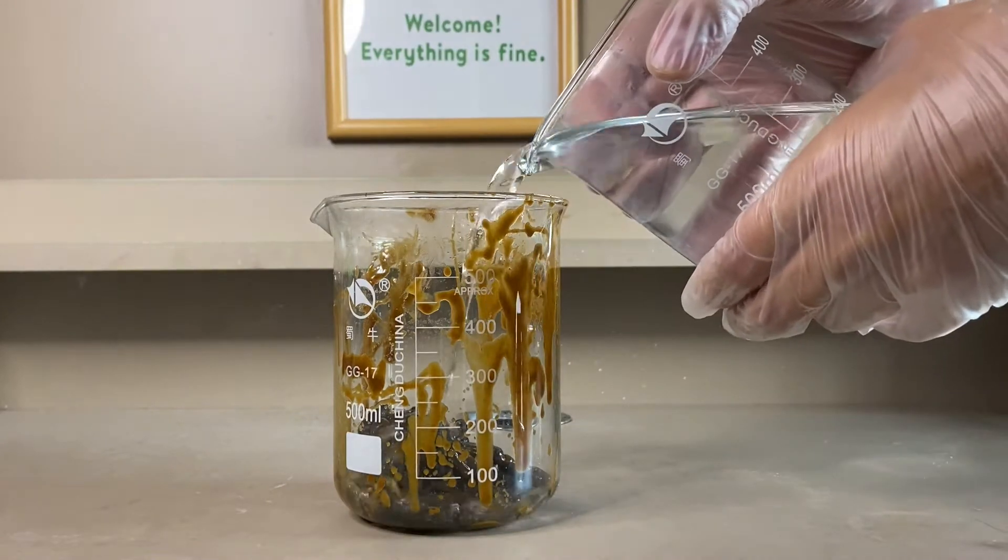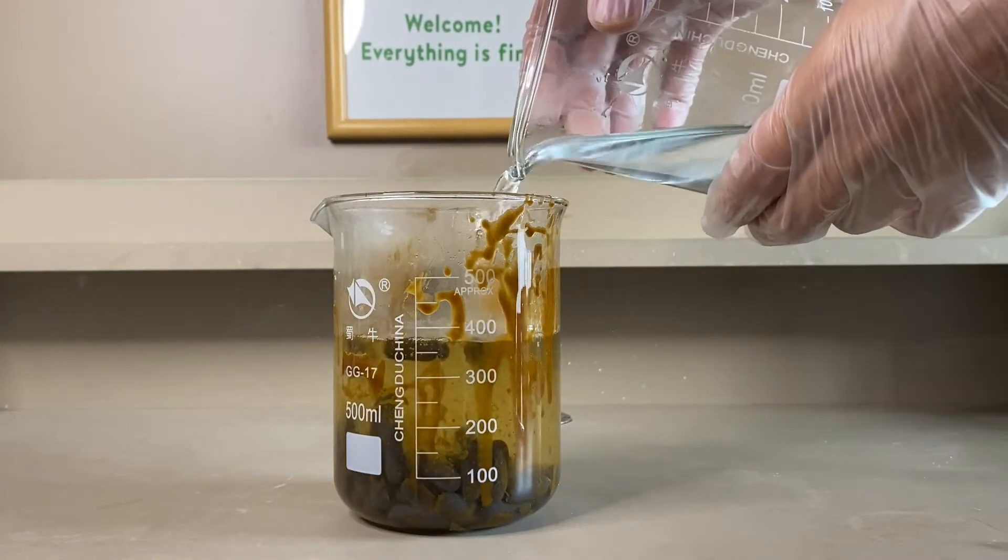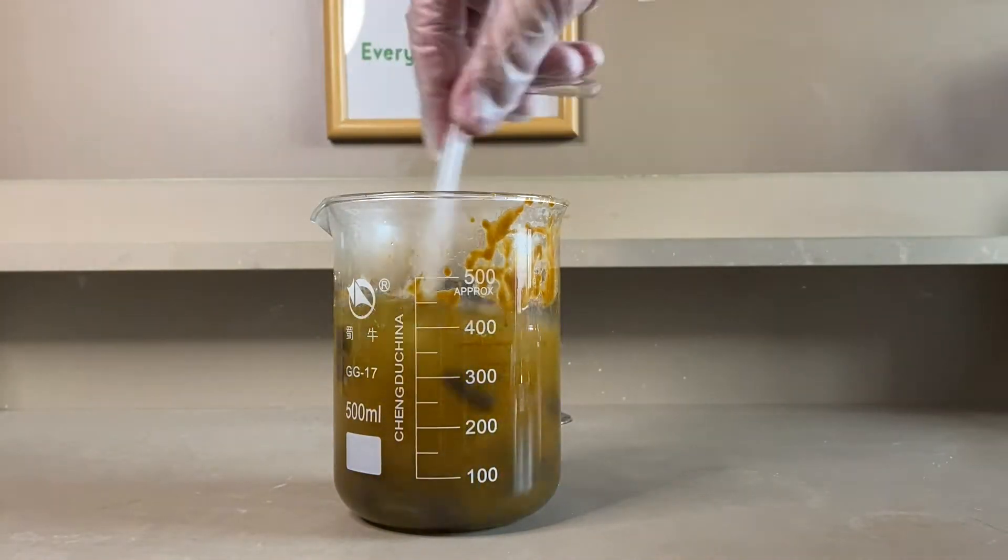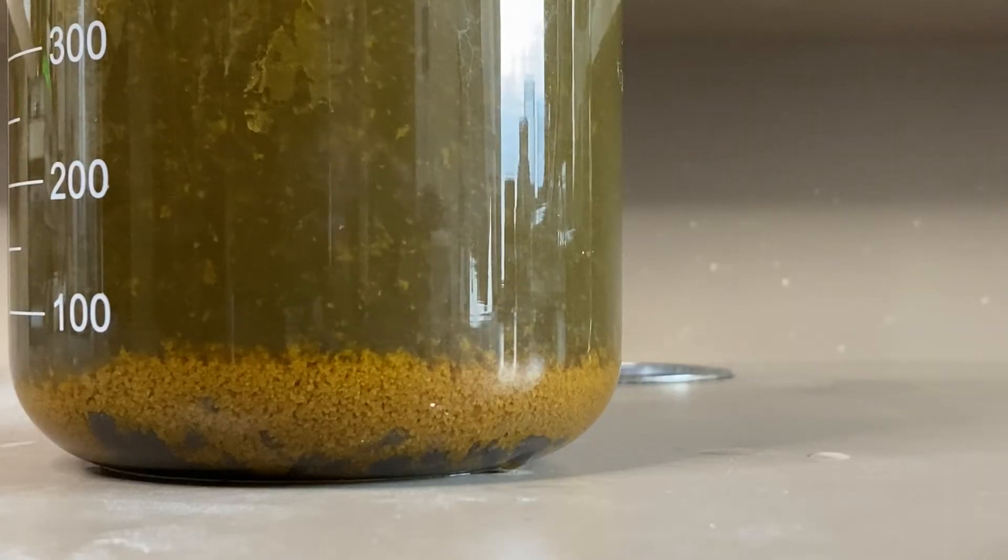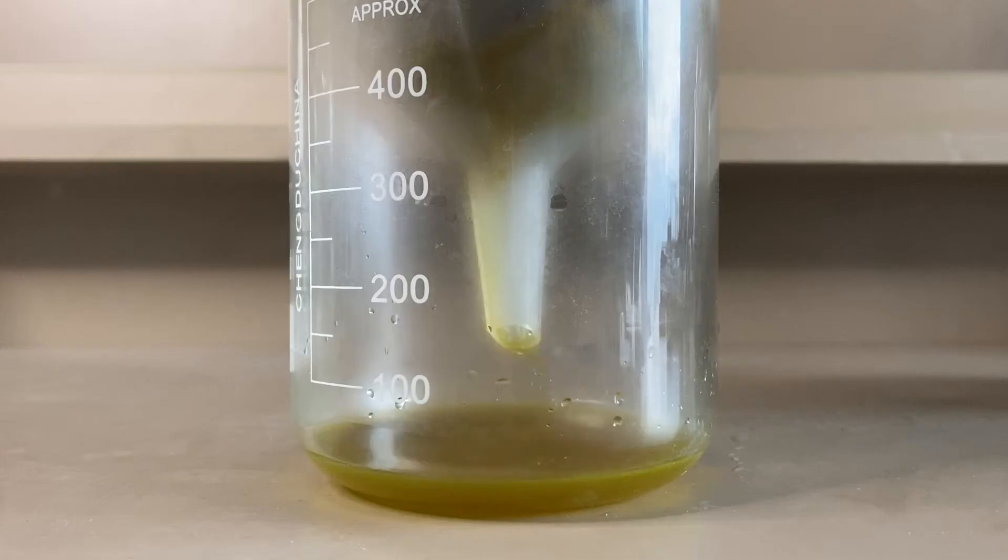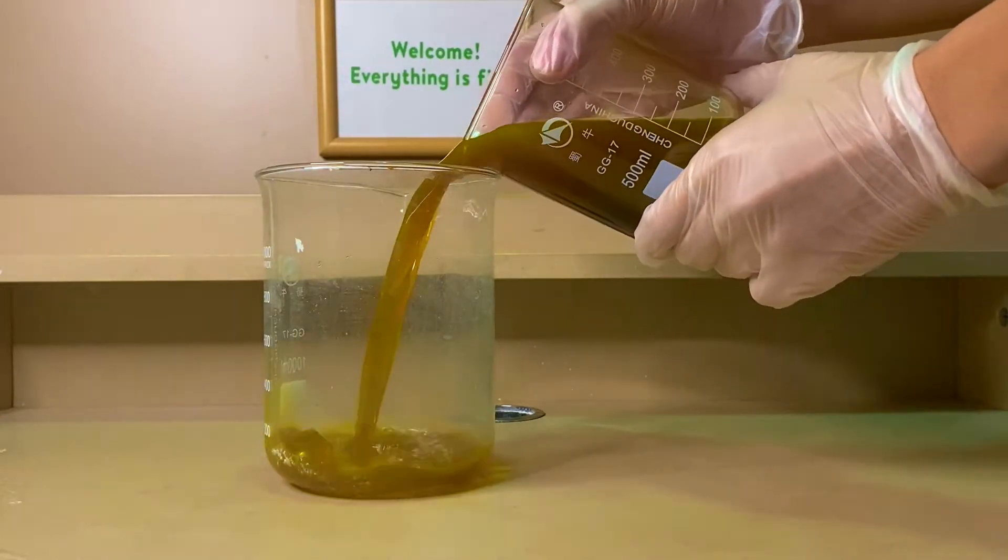Anyway, I added some boiling water to dissolve the ferrous sulphate. A lot of things stayed undissolved, so I performed the filtration and transferred the filtrates into a large beaker.